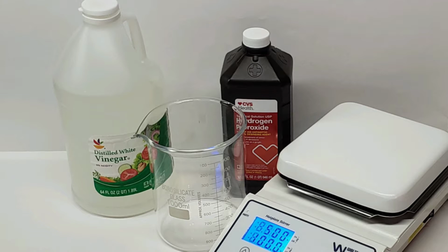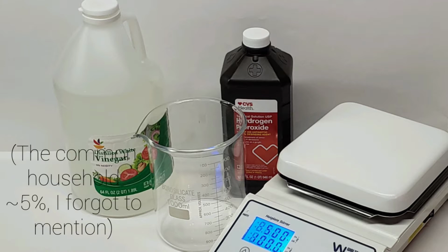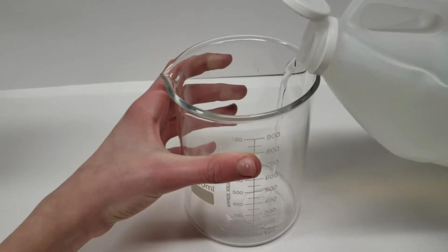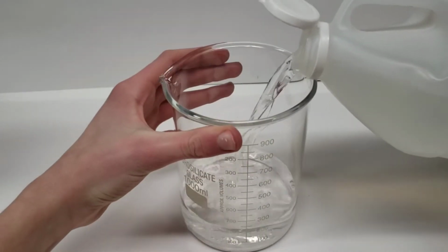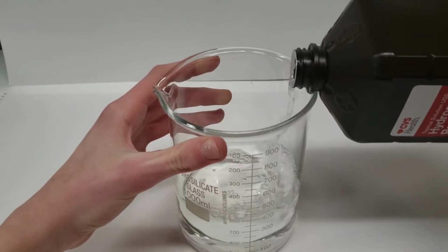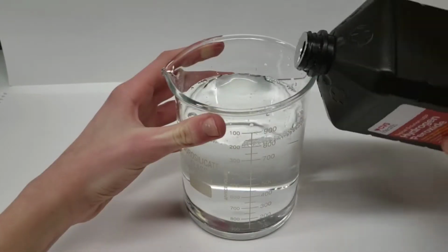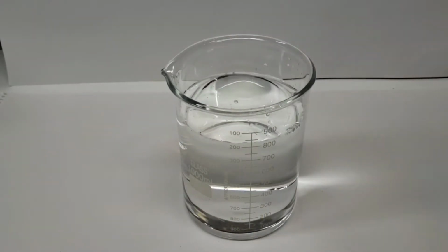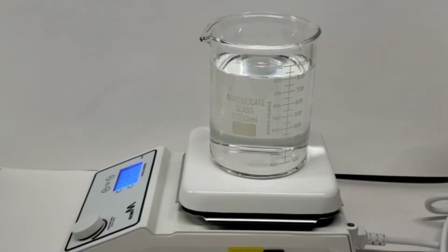So as you can see, starting out you need vinegar, of course your acetic acid for your acetate, along with hydrogen peroxide to dissolve the copper, and a hot plate or something like that to heat it up. I'm not bothering with the stoichiometry for this, so just mix together approximately equal amounts of the vinegar and the peroxide. Then you can set it on a hot plate and set it to a little under 100 degrees Celsius.